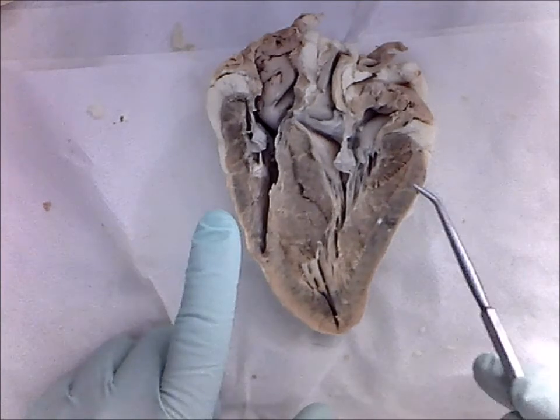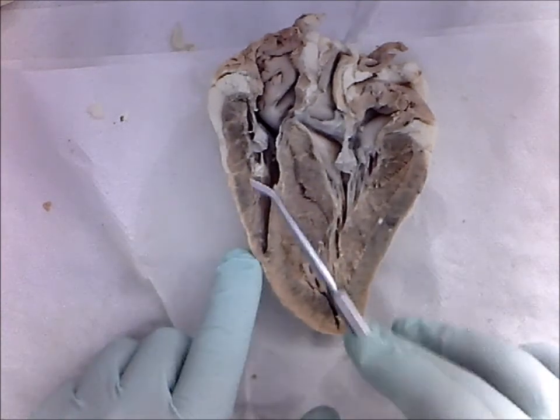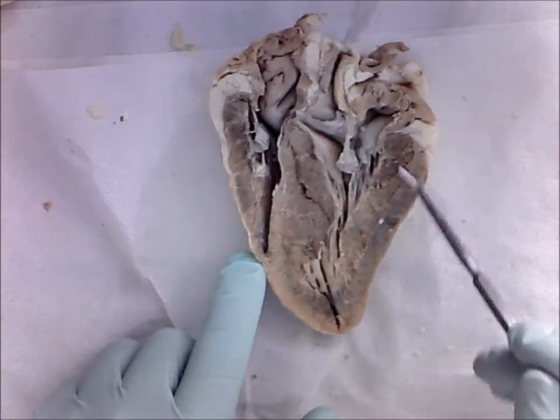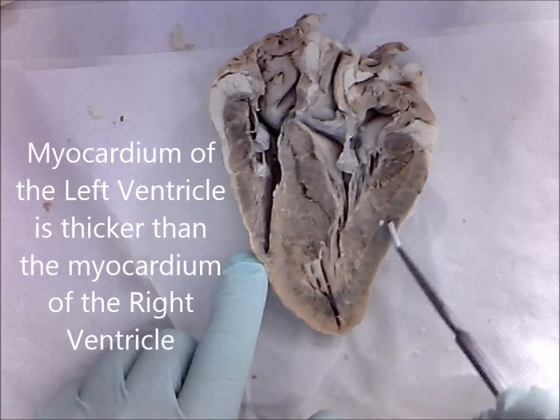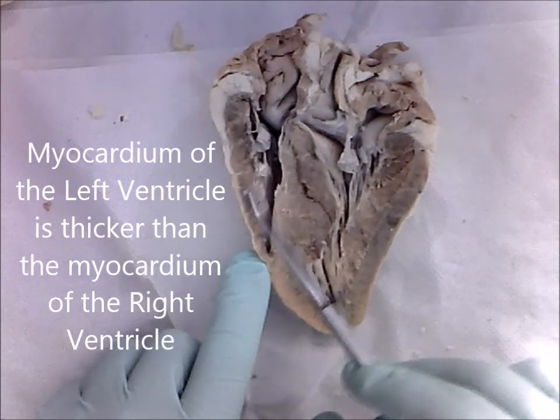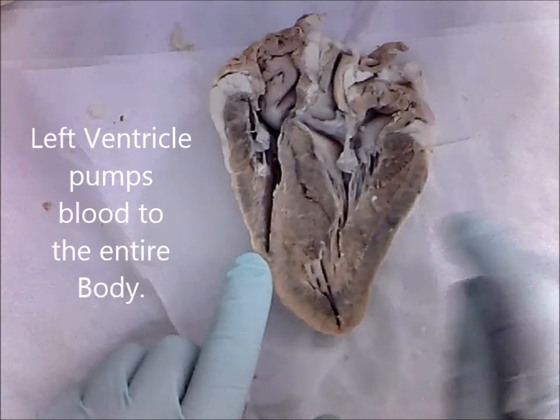If you notice a difference between the walls of the left ventricle and the wall of the right ventricle, you will see that the myocardium of the left ventricle is thicker than the myocardium on the right ventricle. And that's because the left ventricle has to pump blood to the whole entire body.